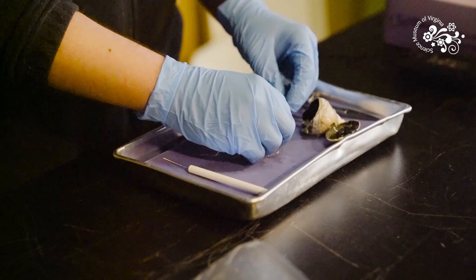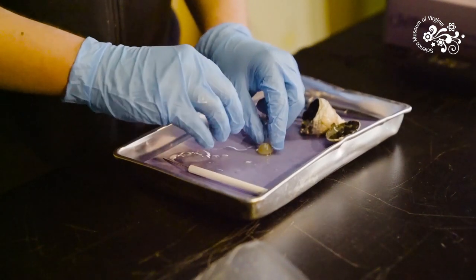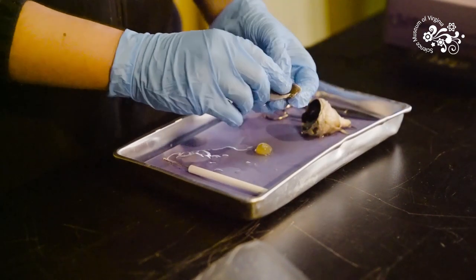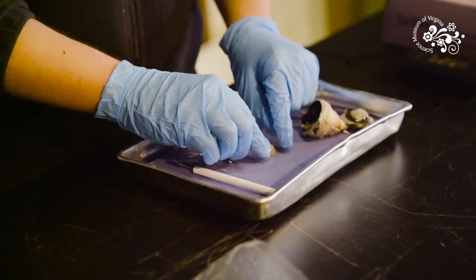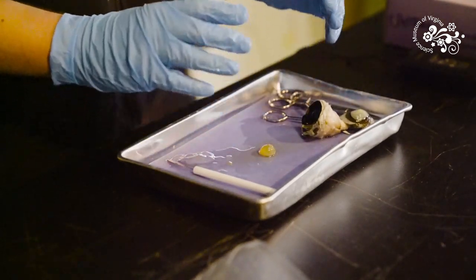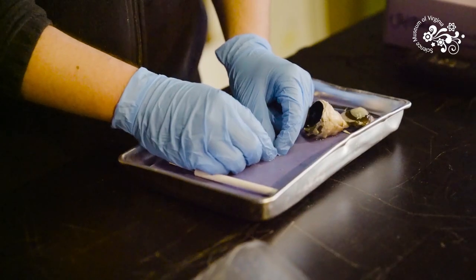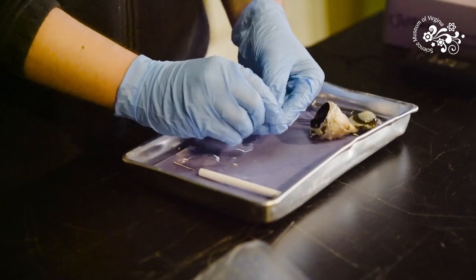Your lens is what does all of your fine-tuned focusing. About 80% of the focusing you do is done by your cornea and your lens does the other 20% and it changes based on whether you're looking at things close up or far away. If you're looking at something close, you have muscles surrounding your lens called ciliary muscles. They will tense up and squeeze the lens so that you can see things closer, and it relaxes when you look at things farther away. If you get eye strain from looking at a computer screen up close or reading for a long period, it's because those ciliary muscles are doing a tough job of squeezing on your lens constantly.